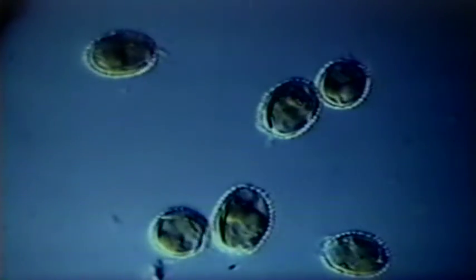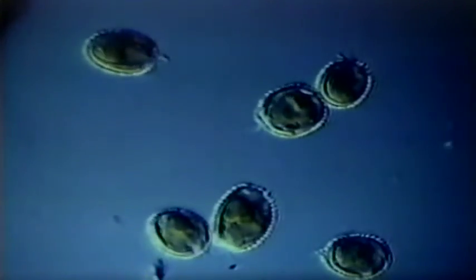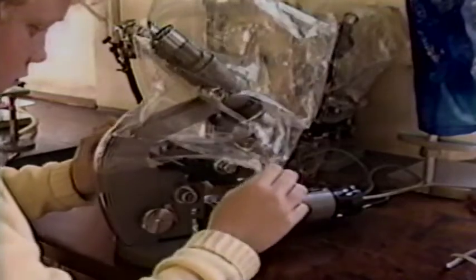In actual practice, the choice of lens first depends on field of view, that is, how much of the object you want to see. Second, on the depth of focus. And third, on the working distance available. With practice and experience, decisions about the choice of objective lens, focus, and illumination all become automatic. When finishing up a session with the microscope, the objective lenses should be checked to see that they are clean and dry. The nosepiece should be shifted so that the lowest power objective is in place and then covered in a dust jacket and put away.